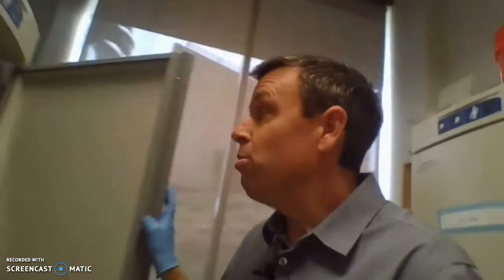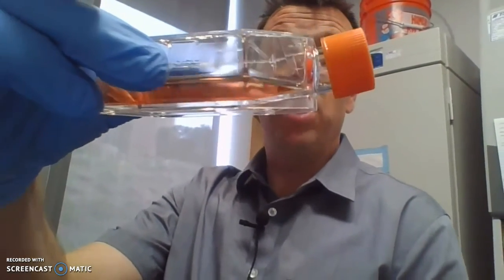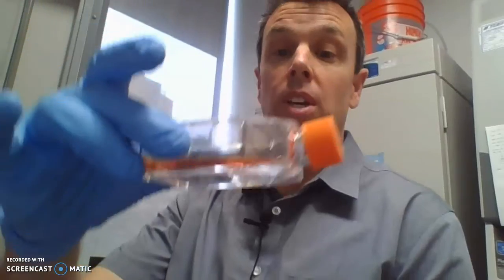If you ever watched Apollo 13, one of the things they were really worried about is if the CO2 in the capsule got over 5 or 6%, because if the natural air outside gets over 6%, your body quits diffusing the CO2 from the cells out into the air, and actually you can die of CO2 poisoning. But the cells themselves are at 5% CO2, and so that's where our cells grow. We have cells growing in these little flasks here. You can see the media at the bottom. The cells will be at the bottom, and we will look at them under a scope in just a second.